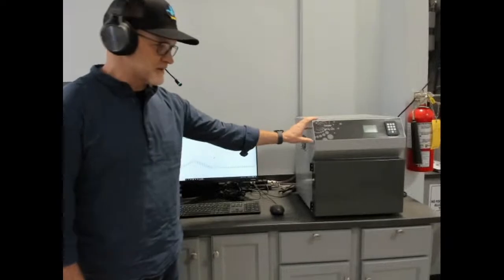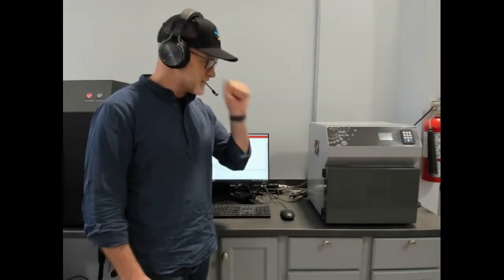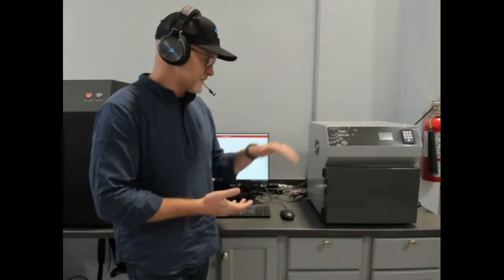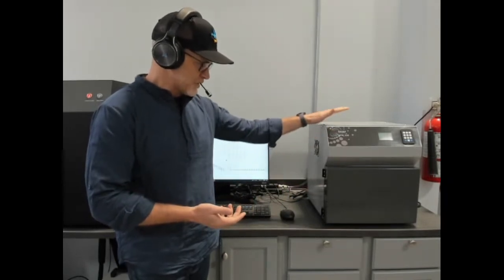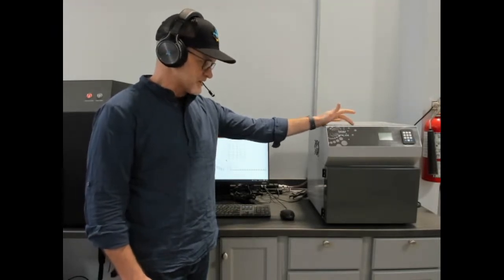Our other steady state device is for the use of insulation, measuring insulation and construction materials. It does follow ASTM C518 as well as the equivalent international standards. There's HFM 100 for measuring up to 4 inches thick or 100 millimeters thick. There's a high temperature version as well as a standard temperature version. You can add the ability to measure specific heat or extended conductivity range.